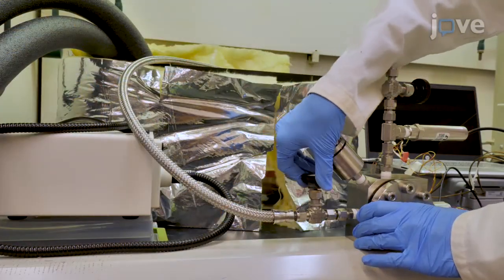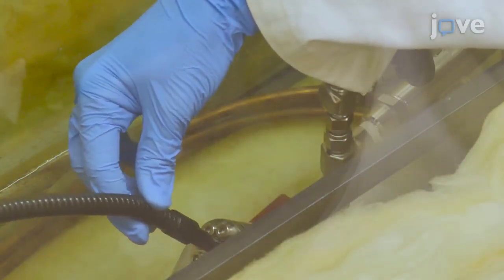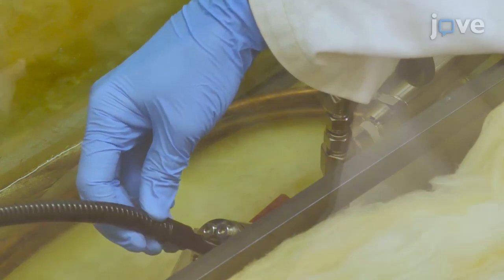Open the pressure cell inlet valve and set the pressure cell in the aquarium. Then insert a fiber optic light source cable into the pressure cell illumination port.